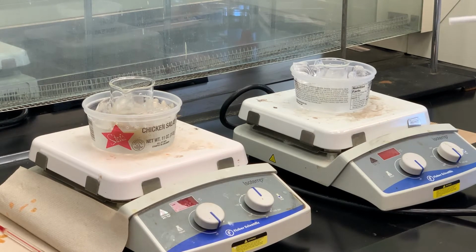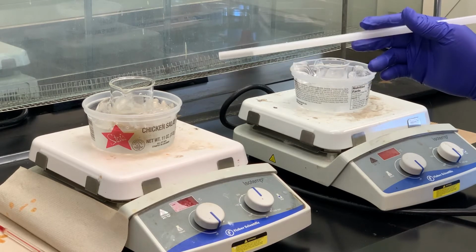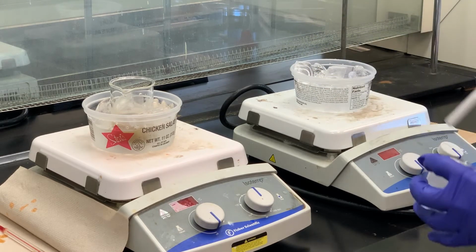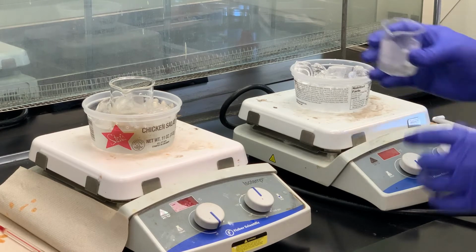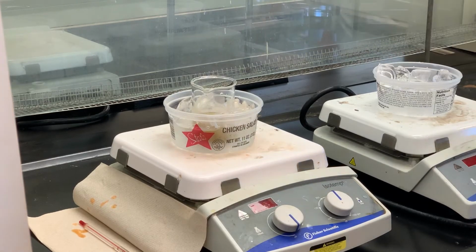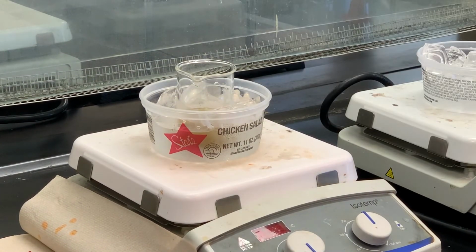We're at 0 to 5 degrees of the diazo component that was dissolved in the aqueous hydrochloric acid. And then here's our solution of the sodium nitrite dissolved in water. I'm going to take the stir bar out and simply dump this into my diazonium salt and let that stir for 15 minutes.